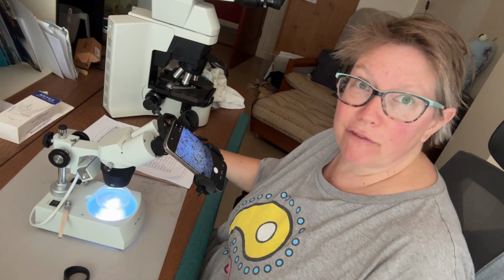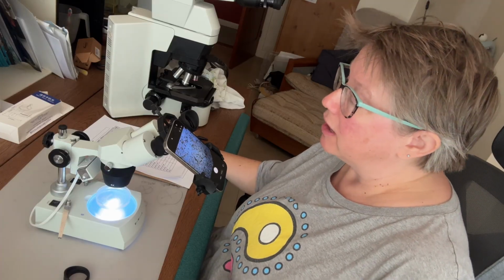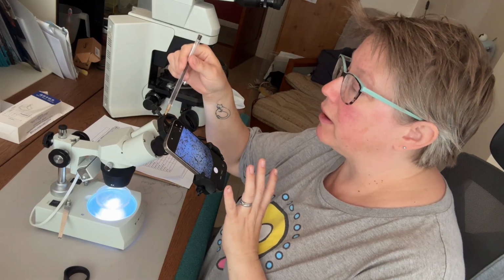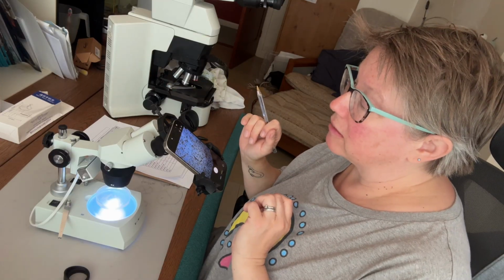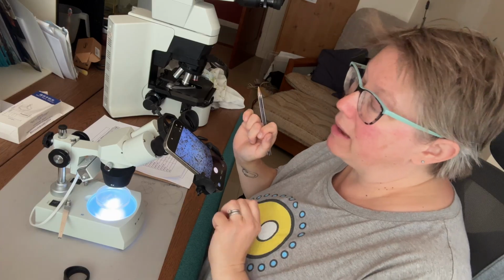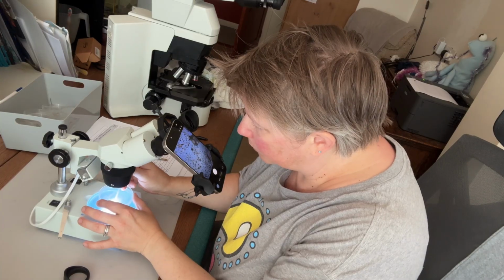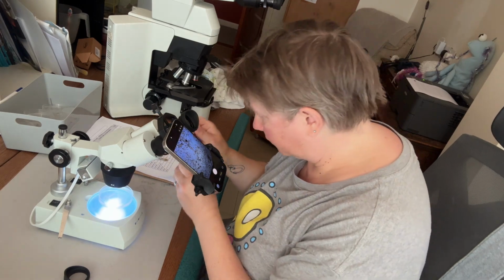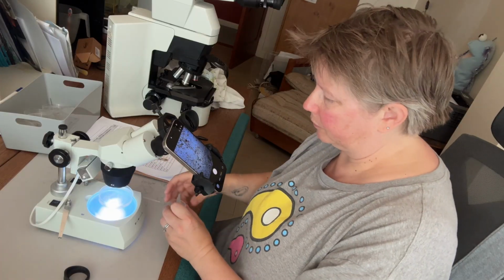Of course, I mustn't forget to take photographs of the organisms that I see for the verification stage. So I've attached my mobile phone to my microscope with quite a cheap adapter here. And I'm just going to take some photographs of the organisms that I see. It may be easier to use a pipette to take out individual organisms of each type, pop it in its own little petri dish to take a photograph of it so that you can get a clear picture and it isn't surrounded by lots of debris or other organisms.